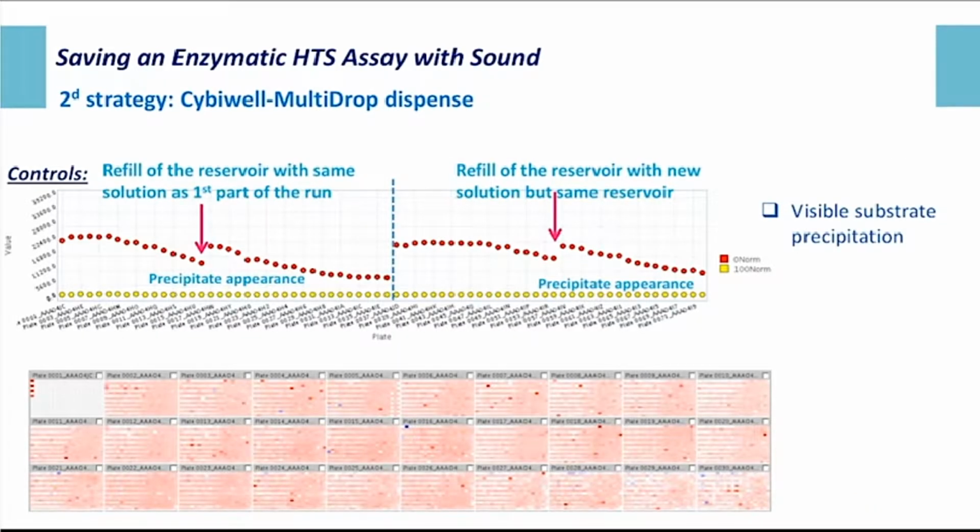Now if we look at the control monitoring results, it's definitely horrible. We observe a strong disruption in the level of the basal signal all along the run, and we were able to link those variations to the precipitation of the substrate in the reservoir of the CyBio well. Precipitation that was increased by the refill of the reservoir, as the reservoir was not big enough to hold the volume for a full run. And as you can see on the bottom part of the slide, on this global overview of the plate, we've got a beautiful line effect on all plates.